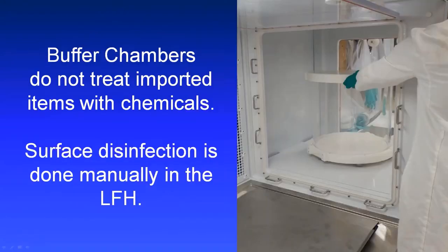Now, buffer chambers do not treat items that you're importing with chemicals the way that some traditional isolators do. Items are disinfected manually in the laminar flow hood before they're brought into the system, and we'll show this as part of the training later on.